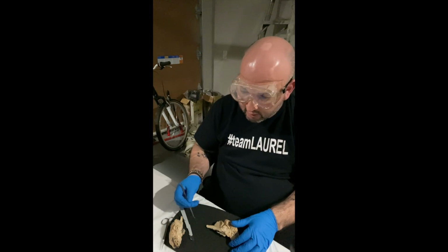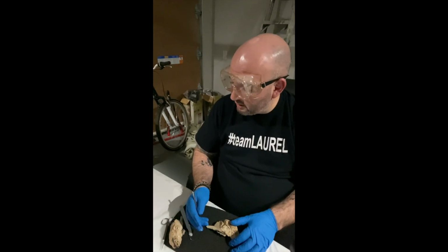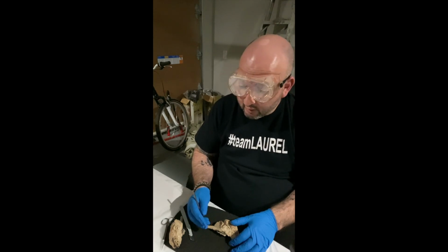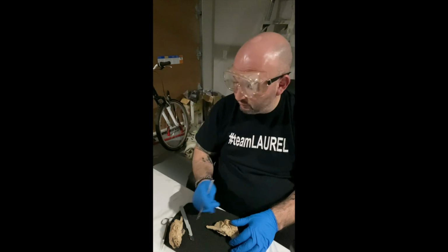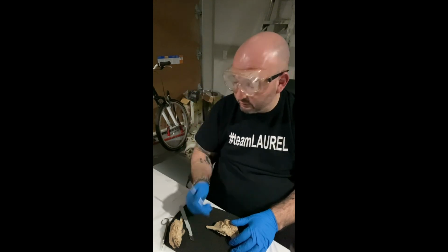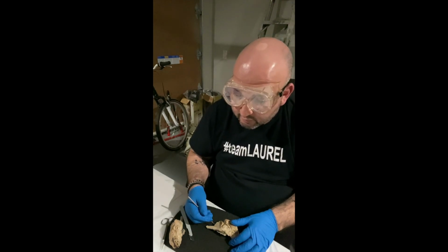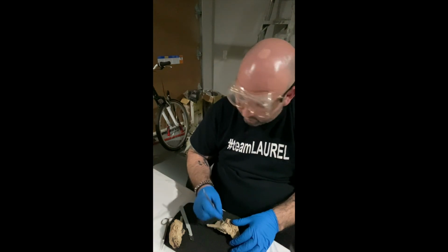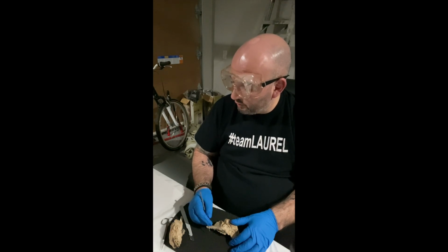The medulla oblongata is this portion here. This is our medulla oblongata. And this helps regulate breathing, heart and blood vessel function, digestion, sneezing, and swallowing. Our midbrain is located here. And again, the midbrain controls motor movement, movements of the eye, auditory, so hearing, and visual, what I can see, processing. The optic chiasma in this view is here, surprisingly enough. And again, this is our X-shaped structure that's formed at a point below the brain where the two optic nerves cross over each other on the way to the eyes.